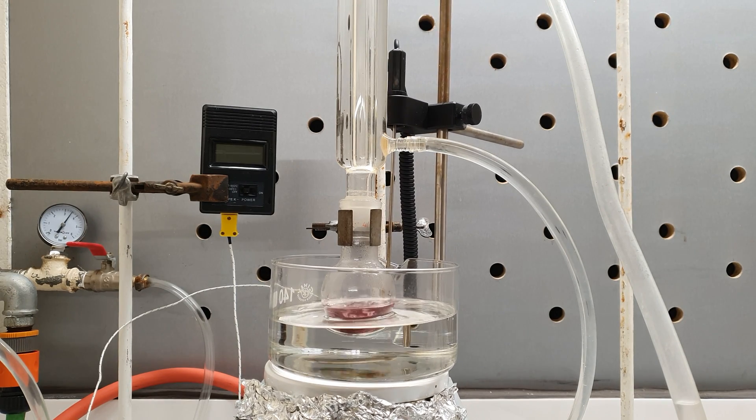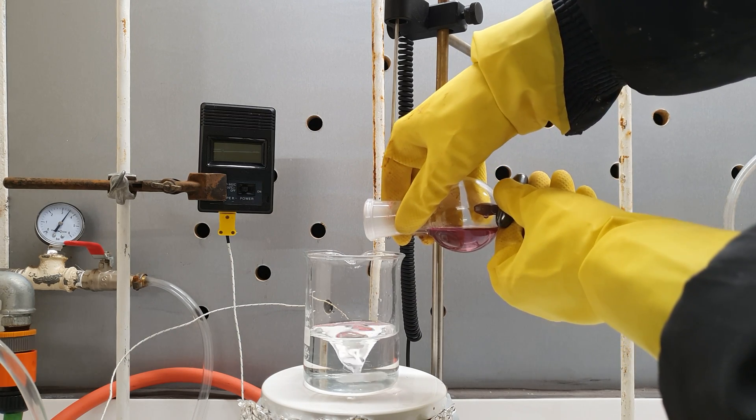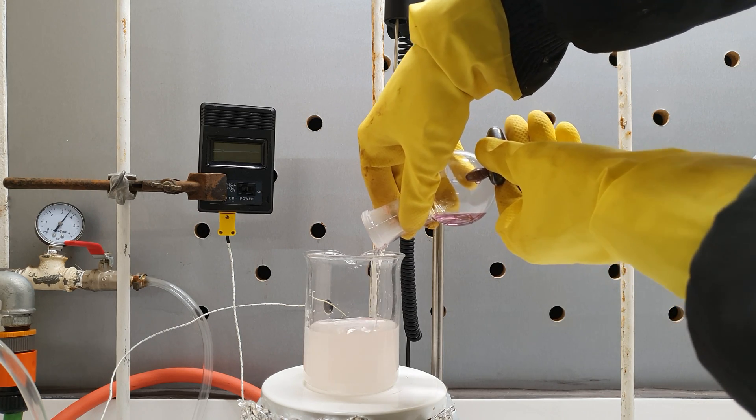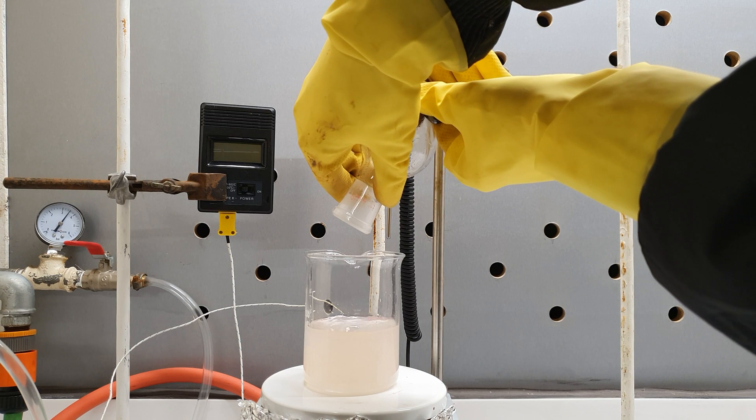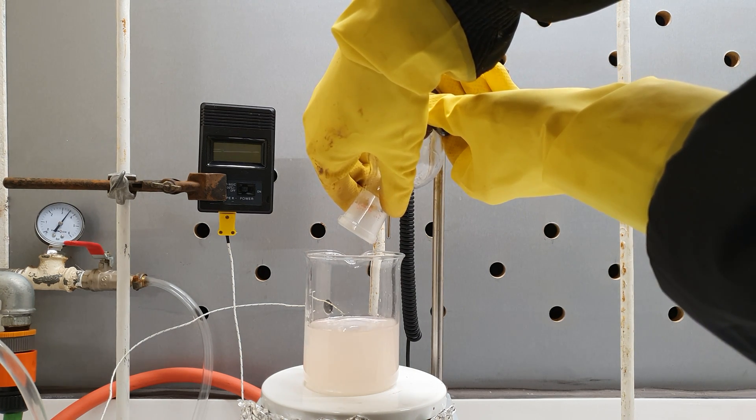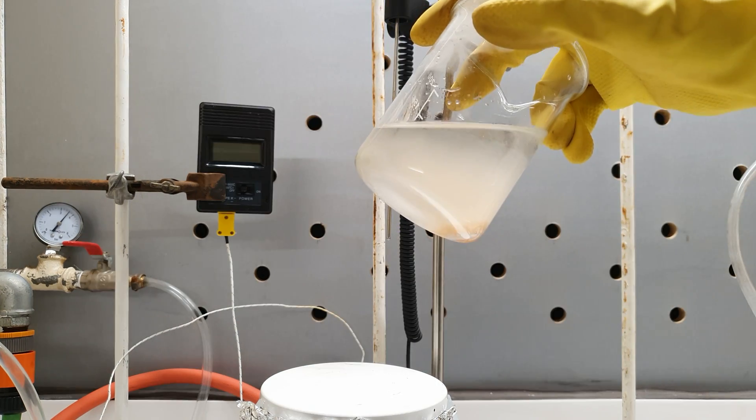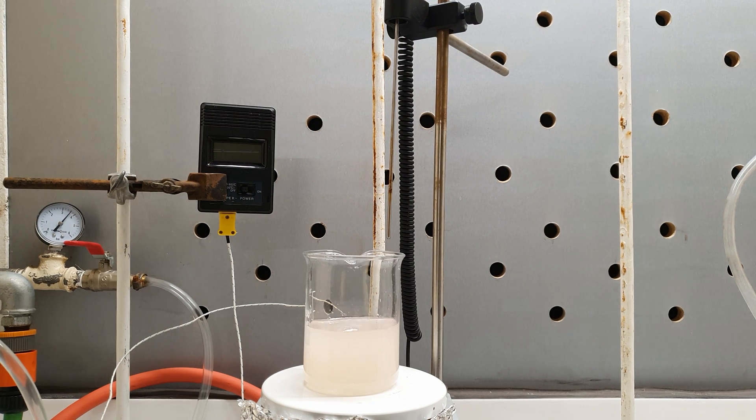After the reaction time was over, I removed the flask from the oil bath and poured it in about 200ml of distilled water. This was the part when things went off recipe. The paper I was following stated that upon addition the aspirin should precipitate out. In my case this didn't happen and instead it separated as an oil. However, this was definitely not the end of the world and it would be a nice demonstration that in chemistry things don't always go as planned.